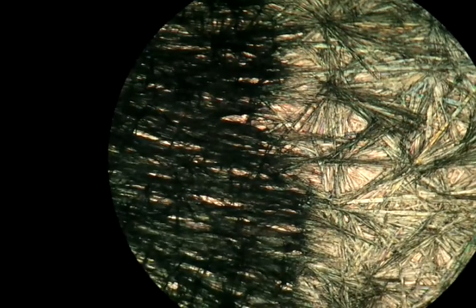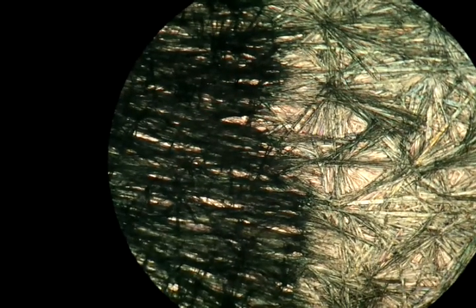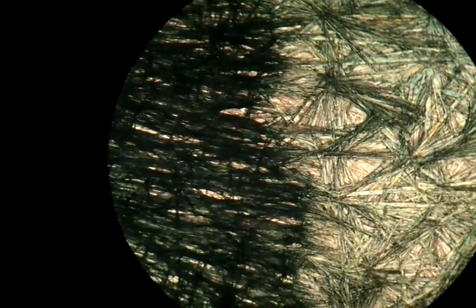I'm turning down the light, I'm trying to focus on this table. Here we go. Now I'm moving the glass plate. This is the edge where the supersaturation stops.